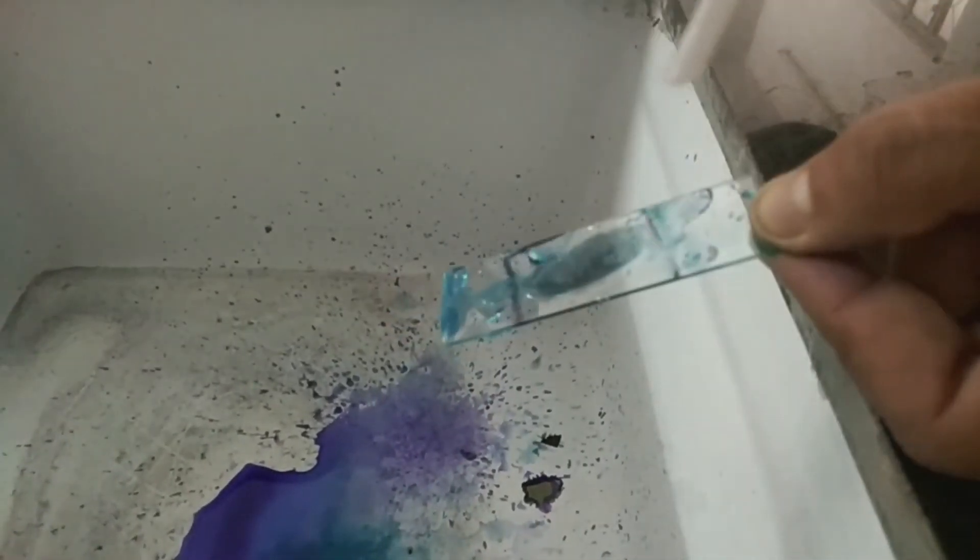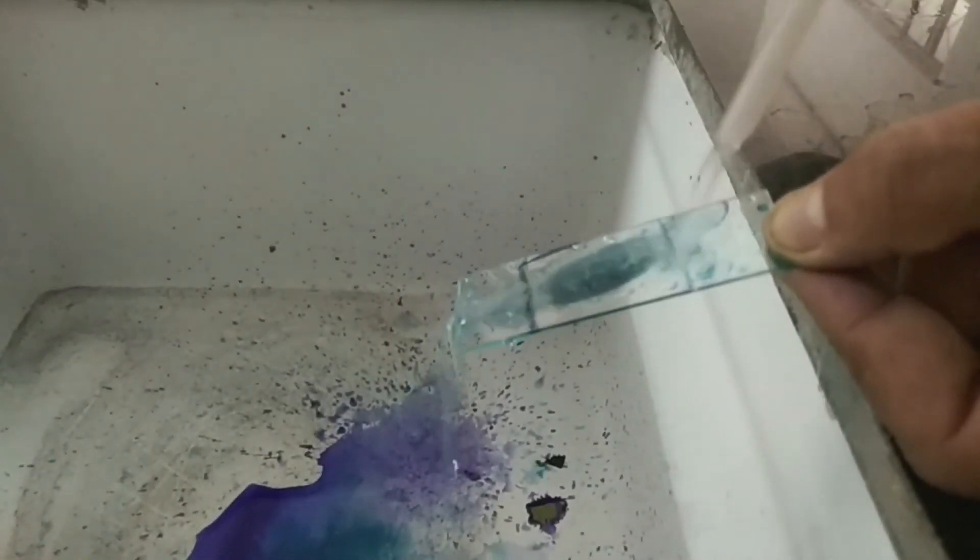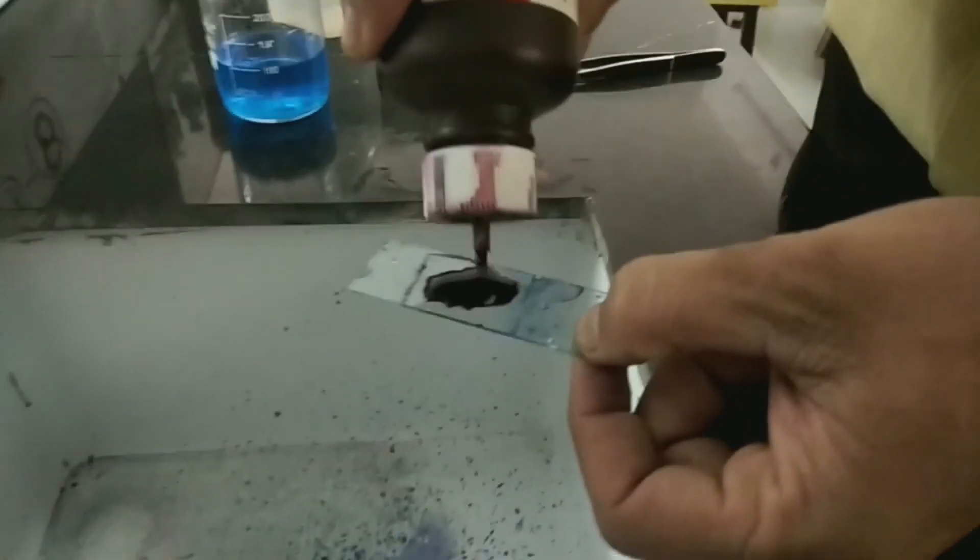This ensures that you can visualize the endospores properly with their proper shape. If excess malachite green is present on the slide, the proper shape of the endospore should not be visualized. After that, counter stain with safranin and let it be for 30 seconds.